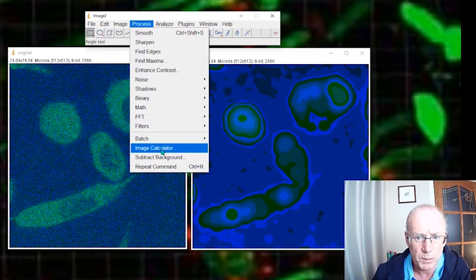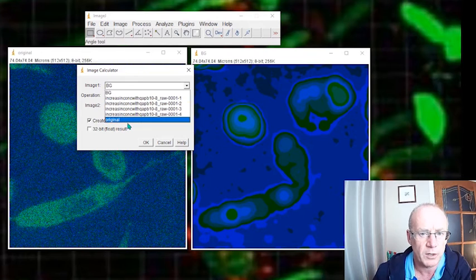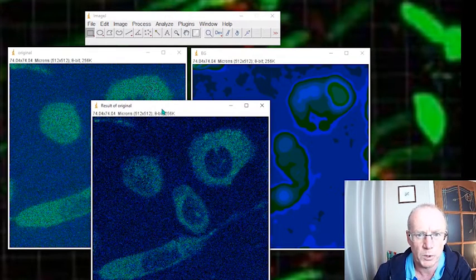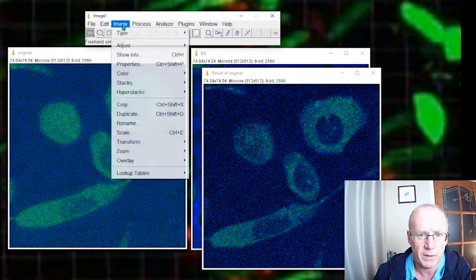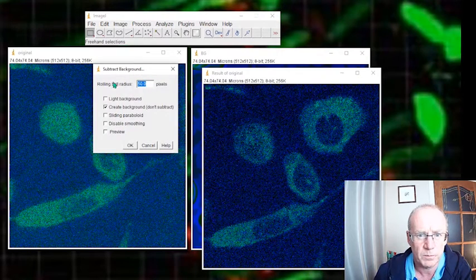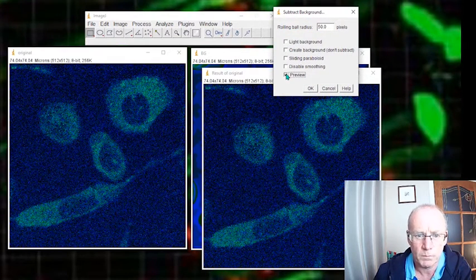What we can do is an image subtraction, using the image calculator. My main image is my original, and I want to subtract from that the background image and create a new image. Boom, there we go. Okay, not too bad. If we compare that with the standard background subtraction, how does that look? Pretty similar, as we'd expect.